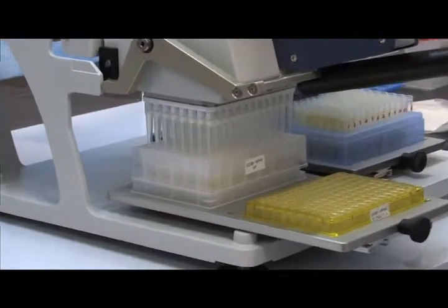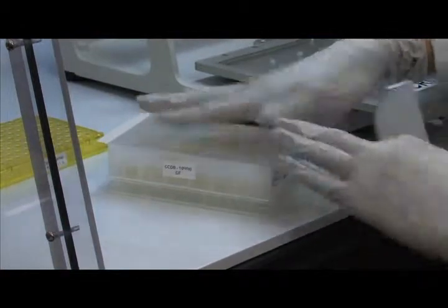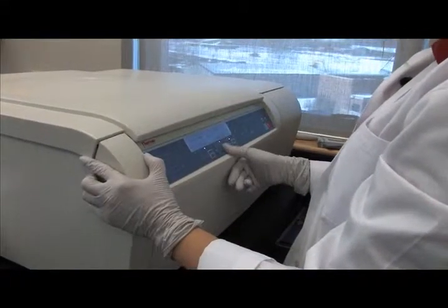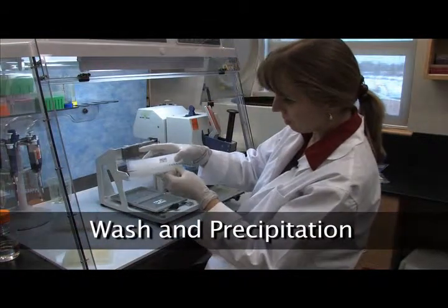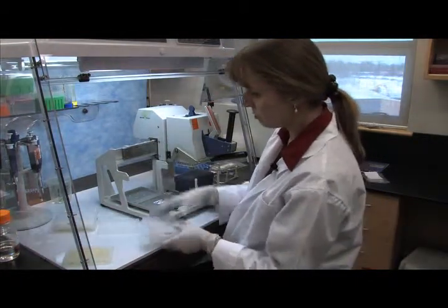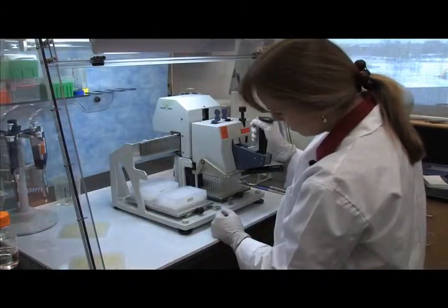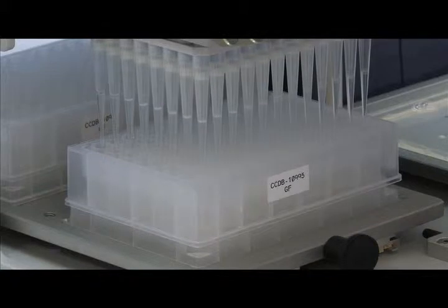Please do not touch off. After carefully dispensing the sample, the extraction plate is sealed and spun on a centrifuge at 5,000 g's for 5 minutes to bind DNA to a glass fiber membrane. DNA binding is followed by two wash steps. Place the glass fiber membrane plate on a fresh support plate to collect the wash buffer.